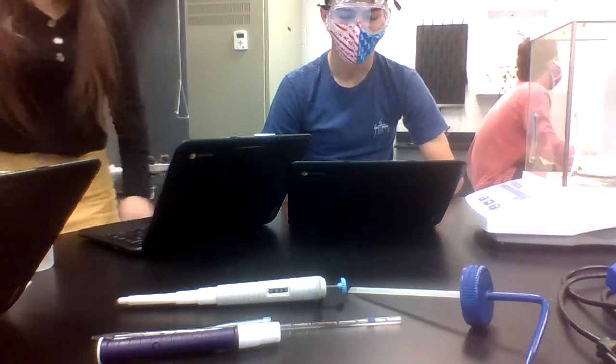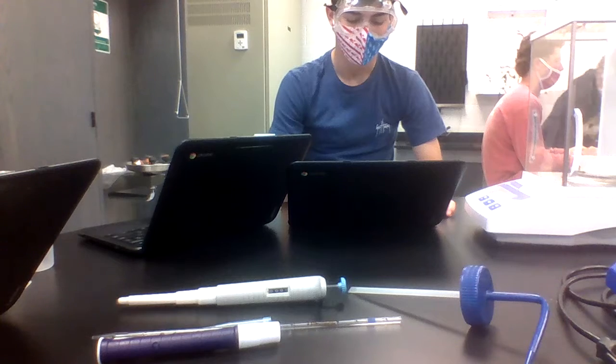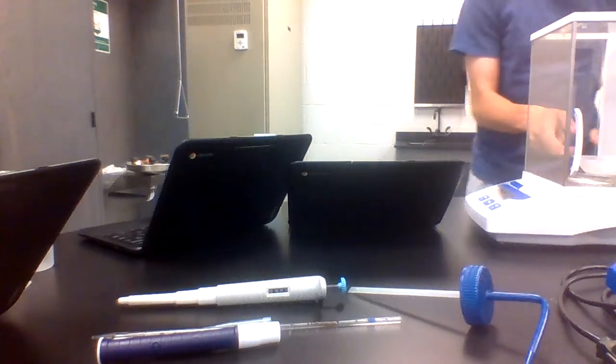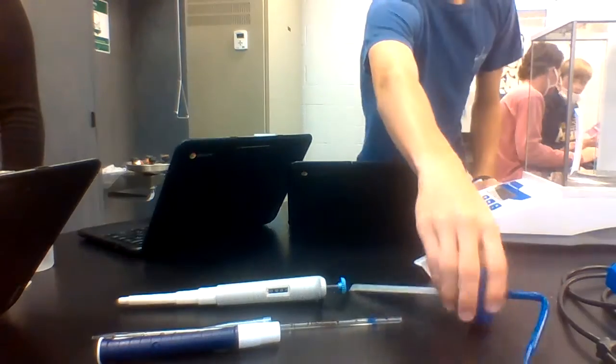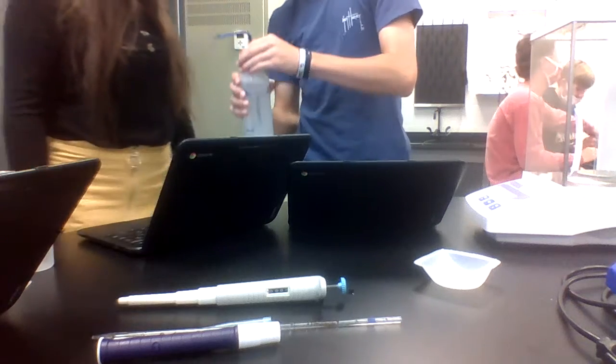Ew, it's yellow on the end. Do you see that? Ew. What did you do? I didn't do that. It was already like that. What are we doing with the thermometer? That's how you measure the temperature. Yeah, that's why it looks kind of weird in the back, because I slept on it and it was black.